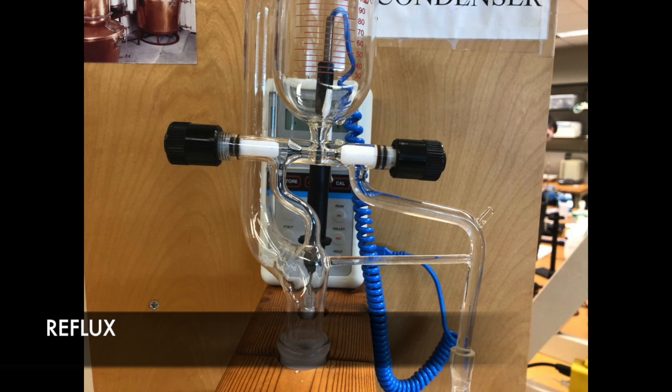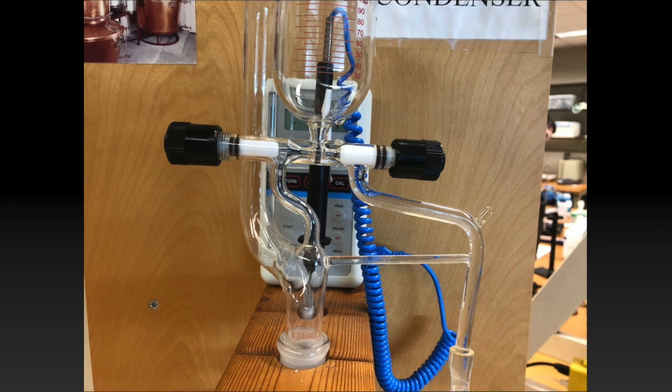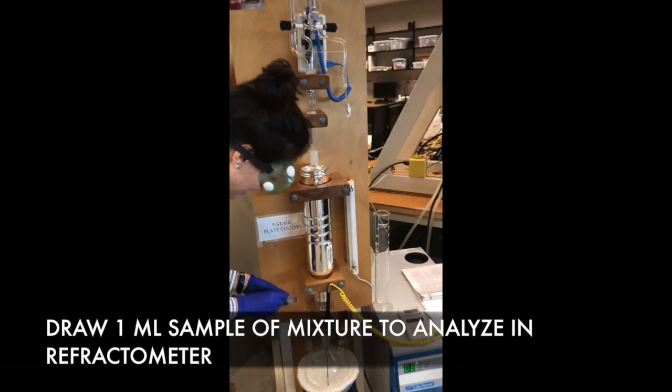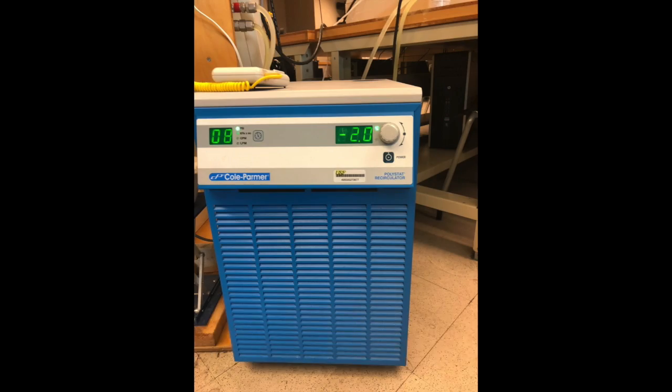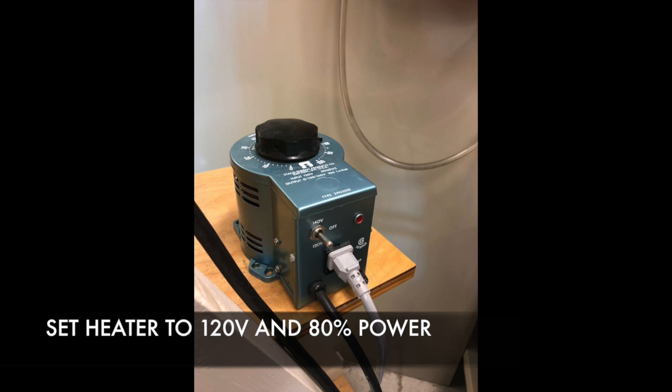Here we have our reflux, which uses valves to control the flow of the vapor that goes back down into the column, as well as the condenser, which condenses the water vapor into the liquid. First, we will take a sample of 1 milliliter from the mixture to analyze in the refractometer. We will first begin by turning the chiller on, which needs to be on 20 minutes prior to beginning the experiment. I'll turn the heater on to 120 volt power and set it at 80%.